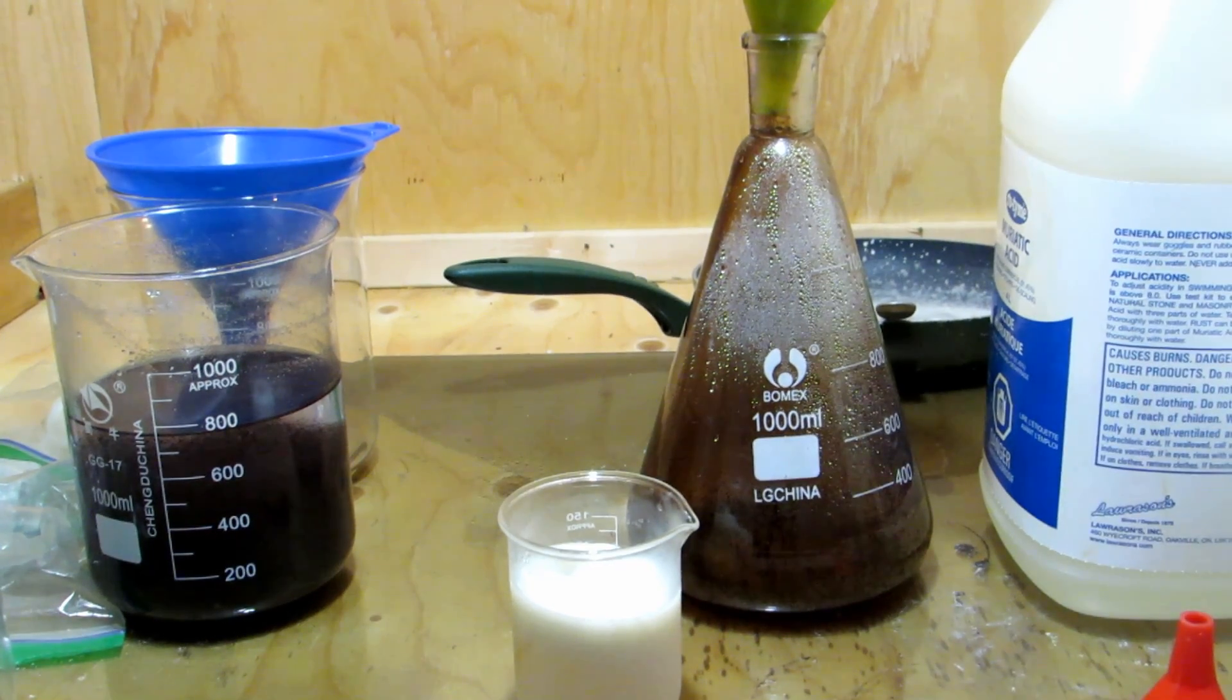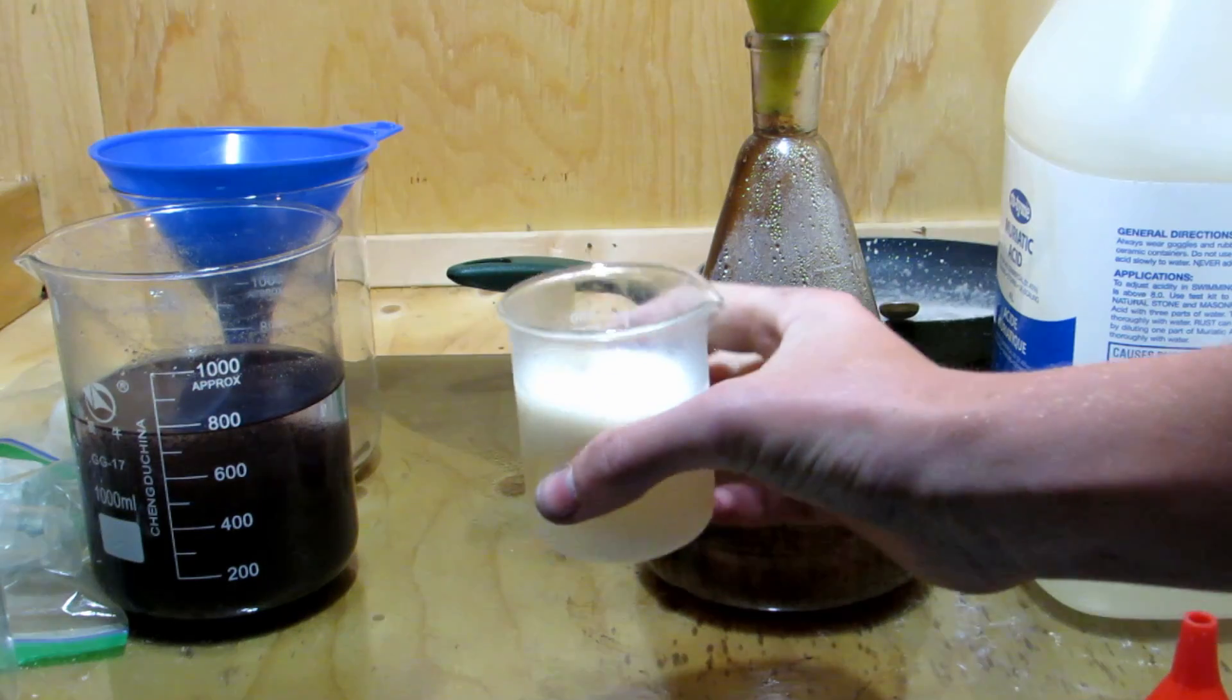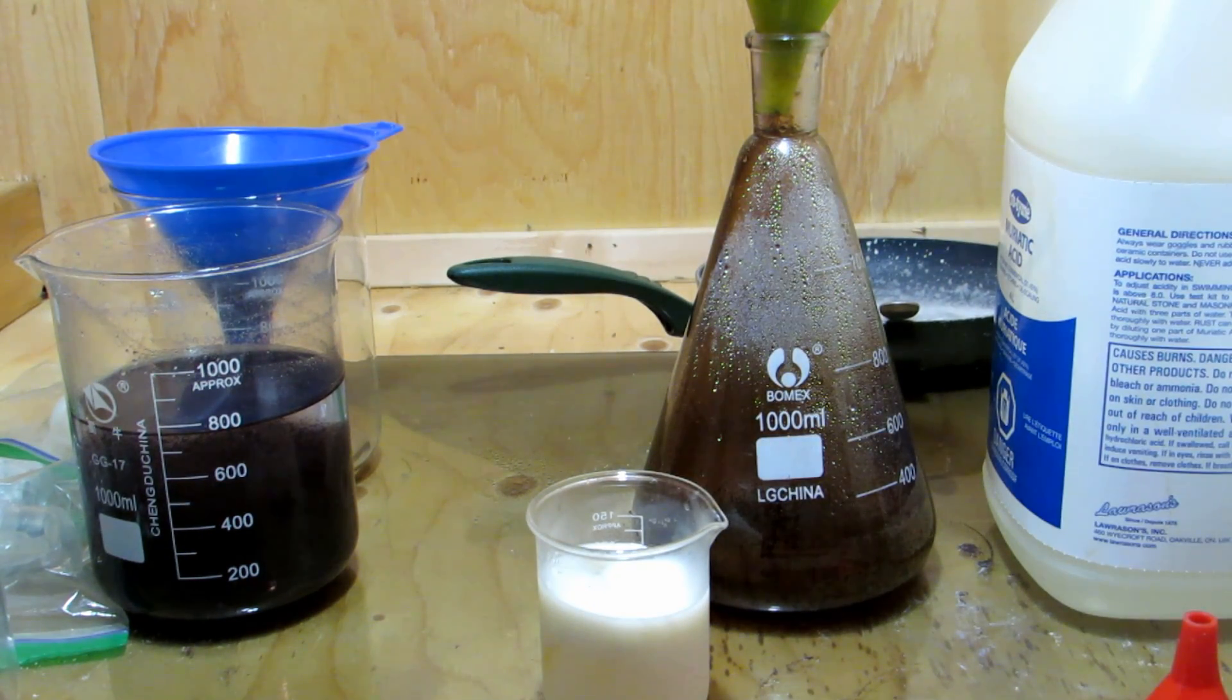This is an oily substance in the funnel here. It's a very thick, viscous liquid. But upon filtering it off, it comes off totally fine. It's not soluble in the water, which is perfect. I'll break this up and we'll try to filter off whatever it is. It looks like we got a fair amount of caffeine. 10 grams is the lethal dose of caffeine. I'm pretty sure we have more than 10 grams here. As long as I don't eat all that, I'll be fine. And I don't plan on eating any at all.